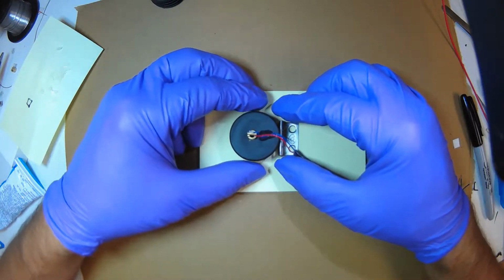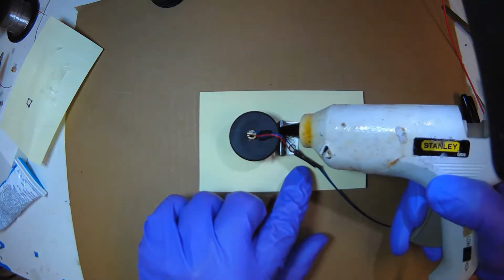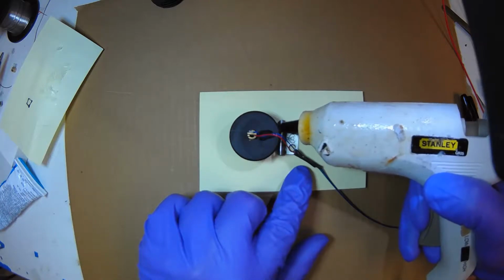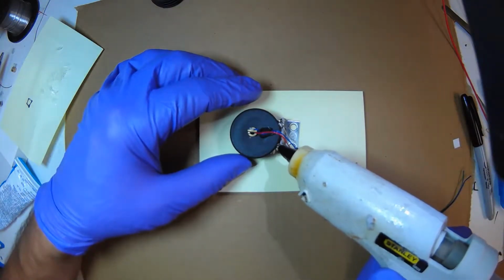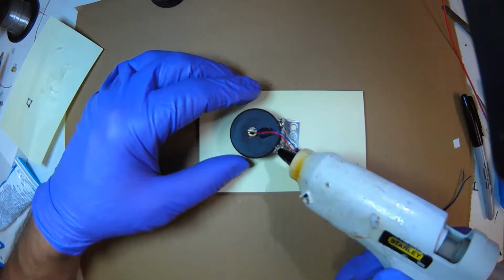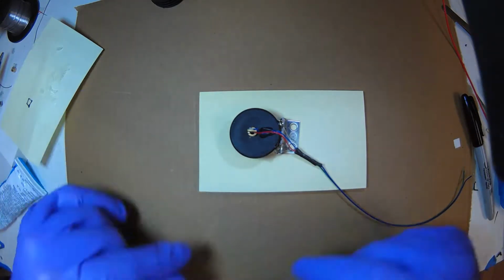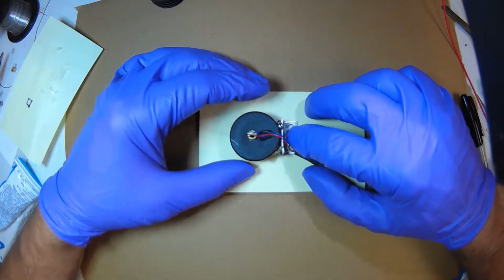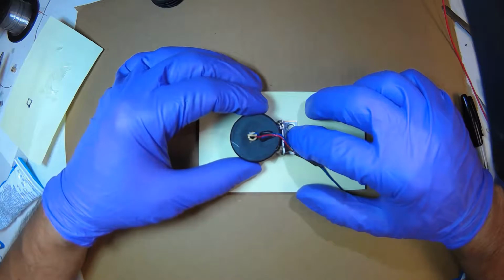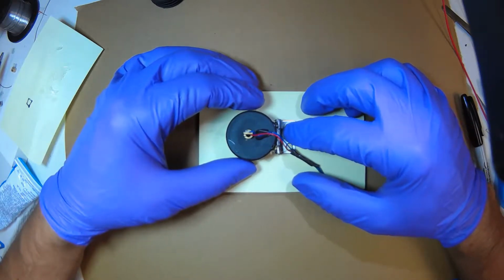Ooh, that wasn't a whole lot. I need a little more. A little more. Let's shove some in here, and shove some in here. Okay, that's more serious tacking. And now I'm going to orient it right. I'm holding the hinge with one finger and making sure it's at right angles. Okay.